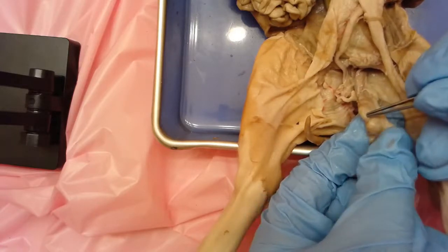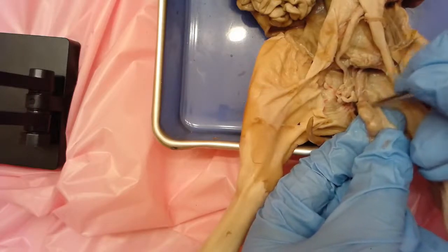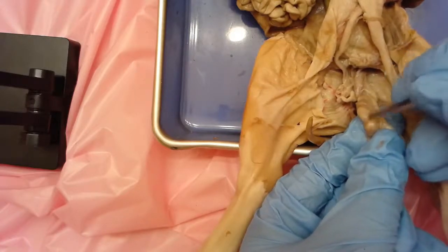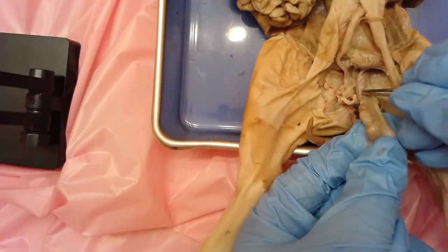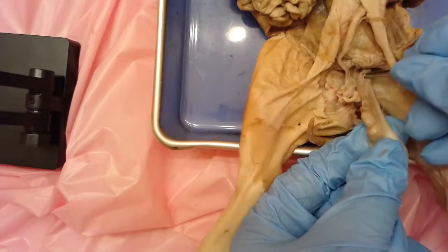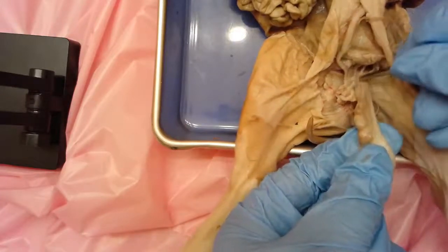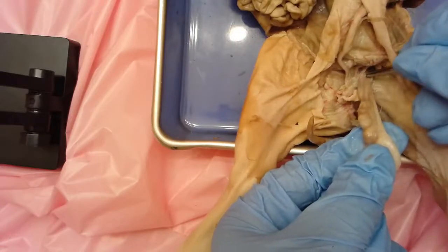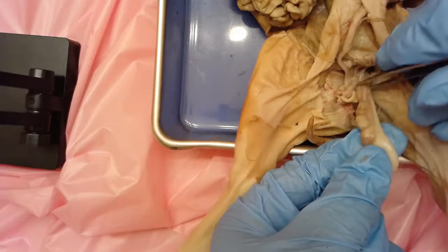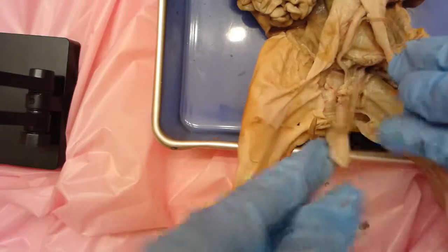Surrounding the testes is the epididymis. The testes is where sperm cells are produced, and the epididymis is where those sperm cells mature and develop. Then they travel through the vas deferens, which is traveling in this cord. This cord is the spermatic cord, and it contains not only the vas deferens - which is the tube where sperm travel - but also blood vessels and other tissues.